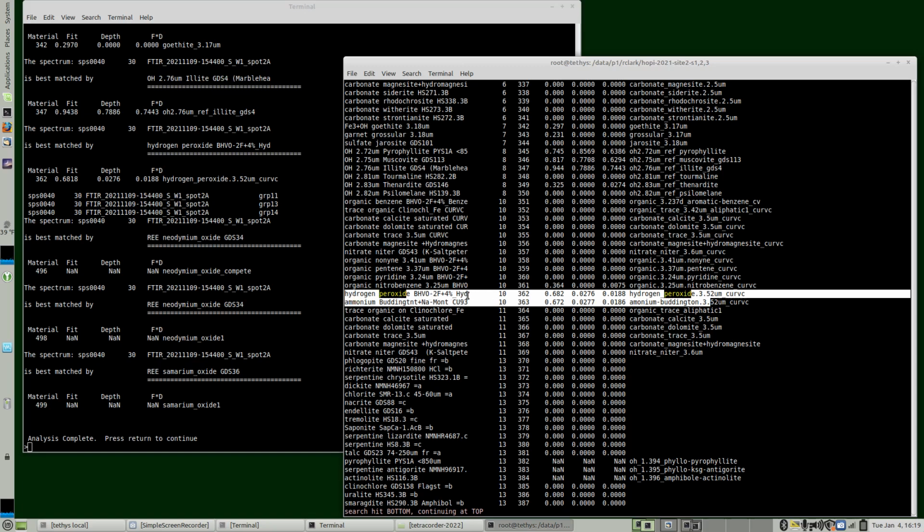So it's a good lesson that the library needs to be complete with enough examples to map what you're doing. We probably should have obtained a sample of this and done an analysis to see what exactly was causing this absorption band, if it was really hydrogen peroxide, or if there's yet another ammonium compound, like a fertilizer, or from ammonium products from animals that get into the soil. So it needs more research to fully resolve this issue, but it gives you a good example of what we're up against when we're pushing new boundaries, and this 3.5 micron region is such a new boundary.